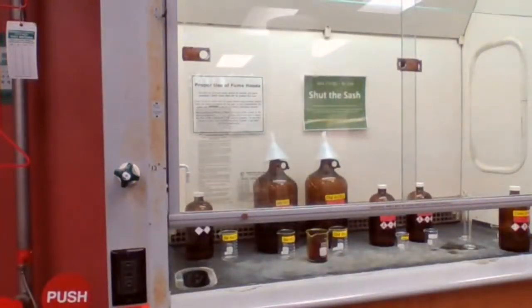I use 100 milliliter graduated cylinder. Oh, I have 50 here.